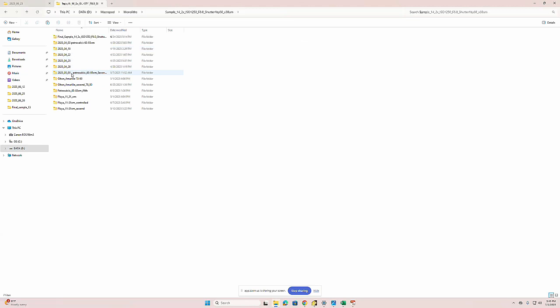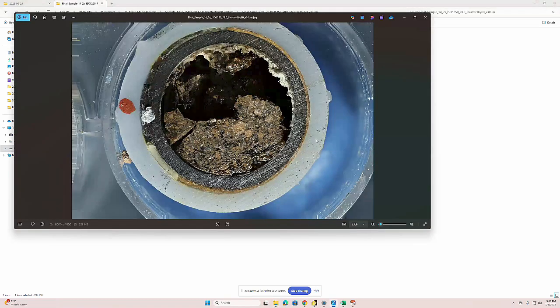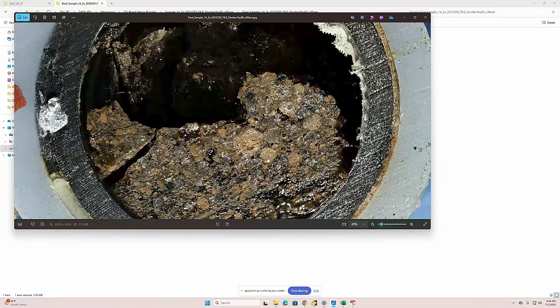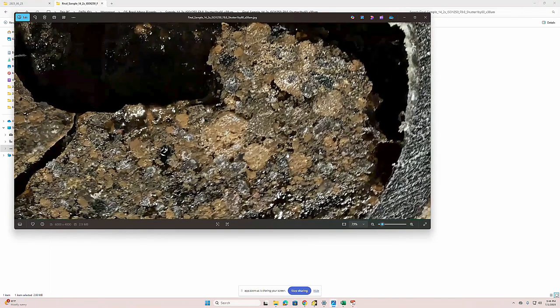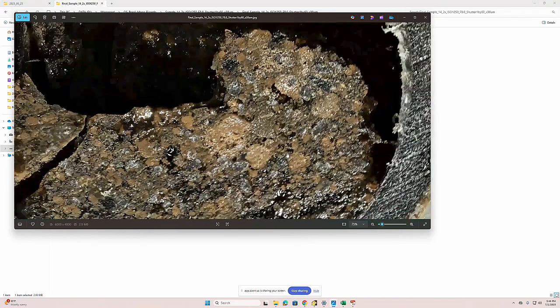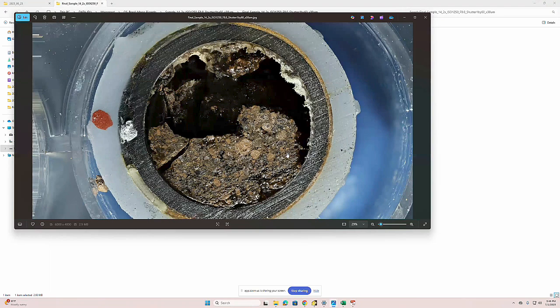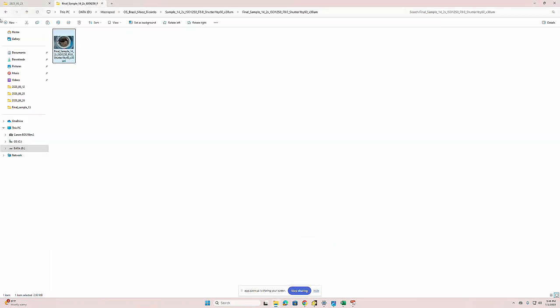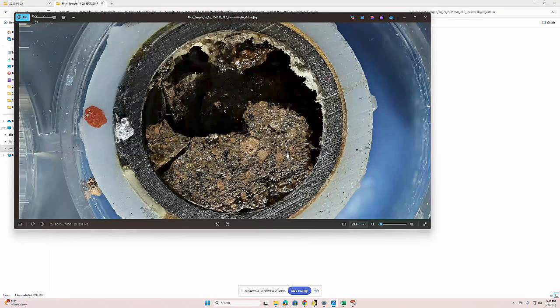Okay, well, how did they turn out? Can I just see real quick? Well, not very well, not really good. Why don't you click on one of them? Well, this one is another photo. If you zoom in, the quality there is good, but your lighting is poor. Because you have a cylinder like that and you have soil that's deep inside, the light looks like it's too oblique.